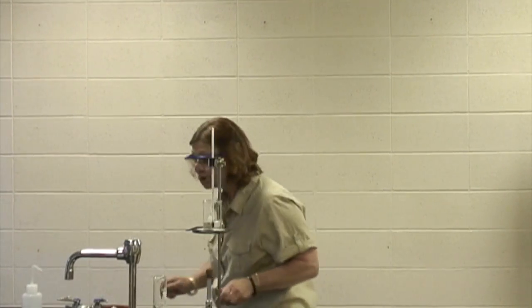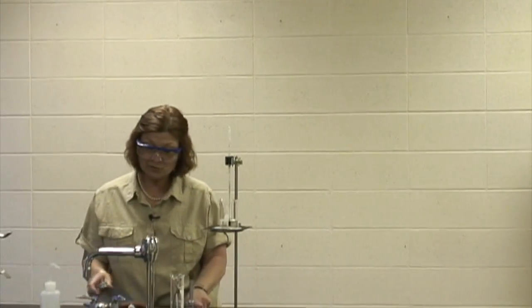And I will return, and the next time I see you, there will be sodium acetate on the ring stand. And I'll be right back. I removed the distilled water and replaced it with my sodium acetate. I measured out 50 milliliters of my sodium acetate, just like I measured out the 50 milliliters of the distilled water. I'm going to turn on the Bunsen burner so that I can get it to the boiling point.